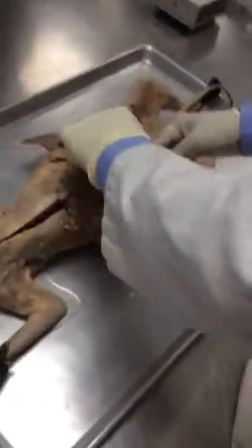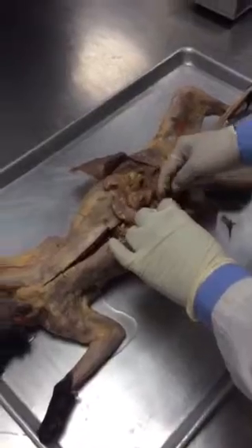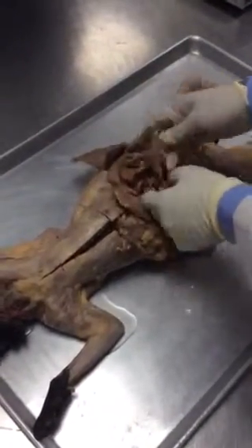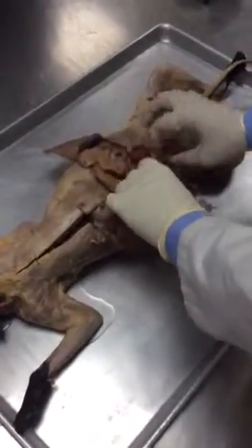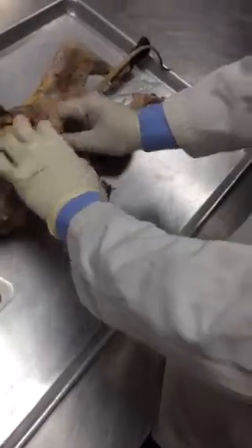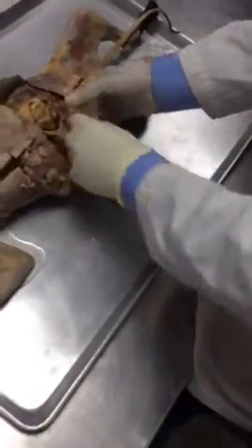So the thing is that you will get questions like this. So this is the mesentery. You see the blood vessels, nerves, and other things are connected, so that the intestine is not Wi-Fi connected; it's physically connected. Okay. So if you trace it like this, at the upper end, you're gonna see where is the upper end. So let's move on to the upper end.